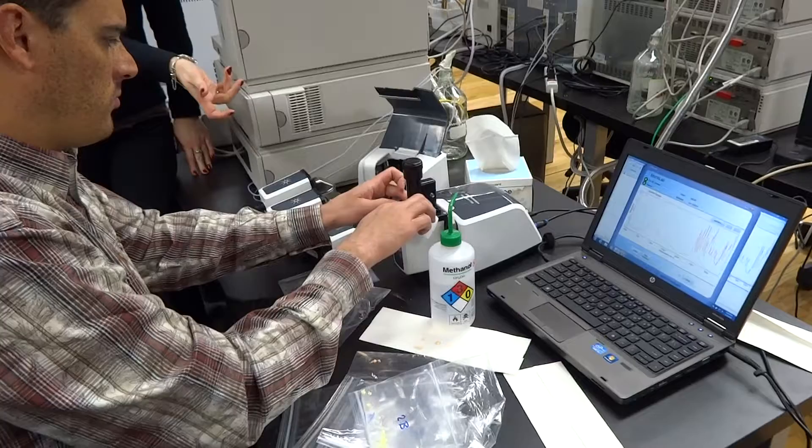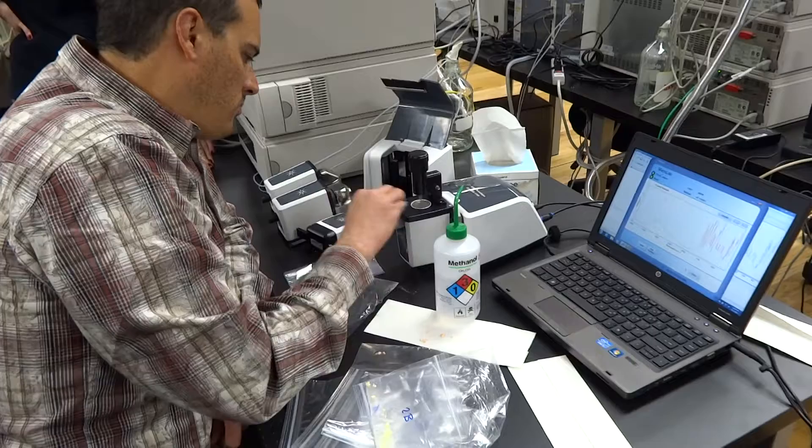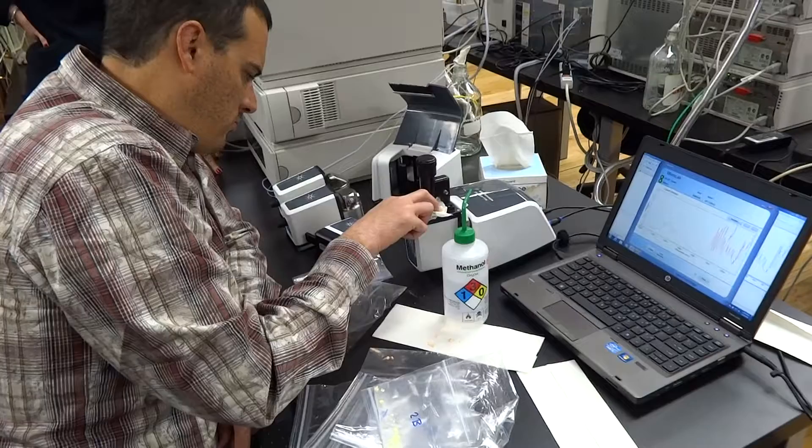And you can remove it, but if you want, then clean it. Or is it just going to test the very bottom layer? It only tests the bottom layer. It tests only bottom. It's a window. So you're literally... It's literally looking up and whatever it sees on that window. So it's not seeing what's up here.